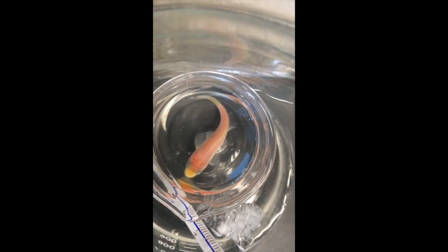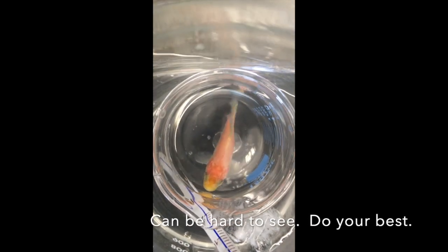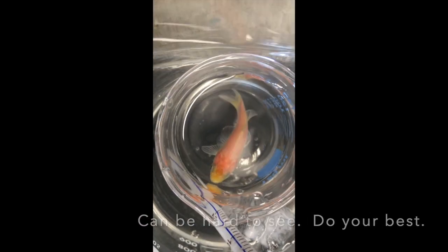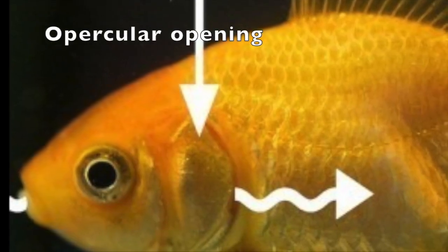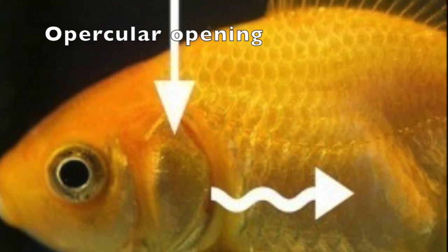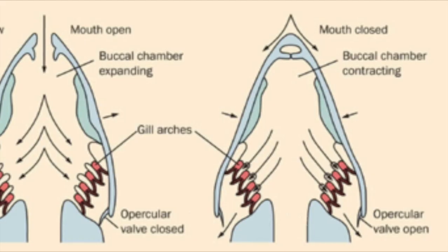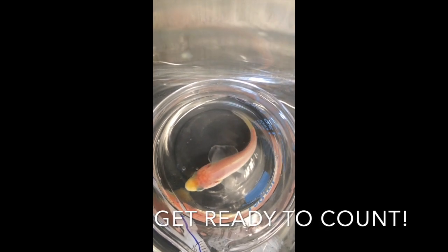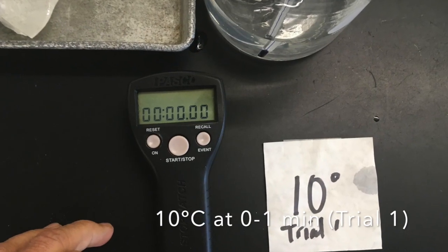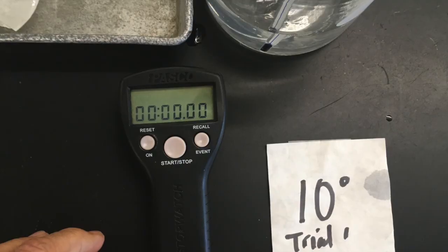You will next be shown one-minute clips of each of the treatments, and your job is to count the opercular movement for each fish in each of those treatments at each of those times during that one minute. There will be nine total times that you count. You can see the operculum — that's the gill opening — moving in this fish right now. Each time I'll let you know when to start and stop; you'll have 60 seconds. First, the 10 degrees Celsius fish. Start counting now.